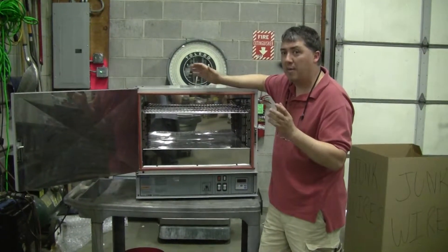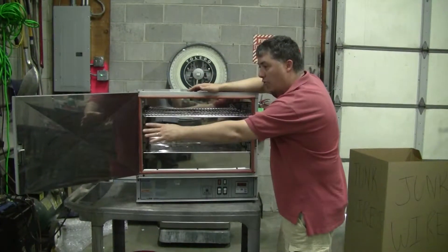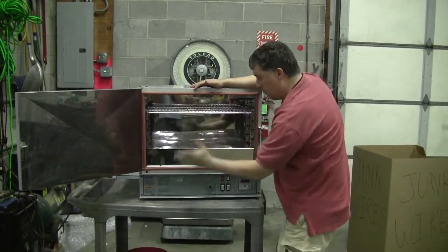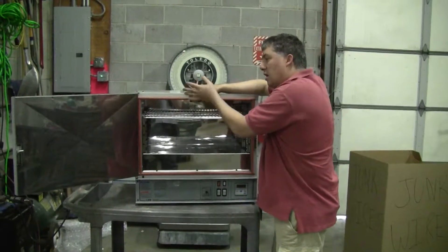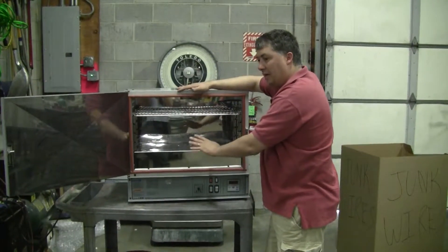That is the primary difference. When you open up that door in a gravity oven, the heat's going to come out. You close the door, heat comes on and it comes back — heat rises, comes back up and then settles back in.